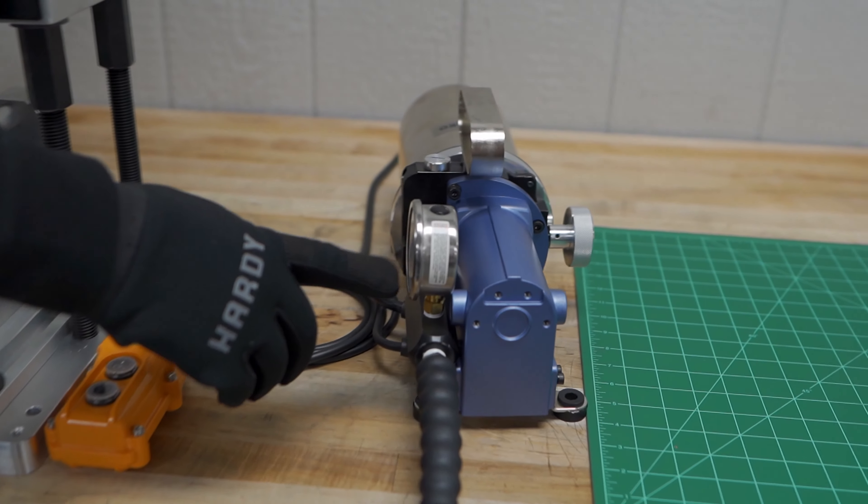Remove the back. We can see our part that's formed inside, and to remove the part, you simply press the back of the ejection button, and that's all it is to it.